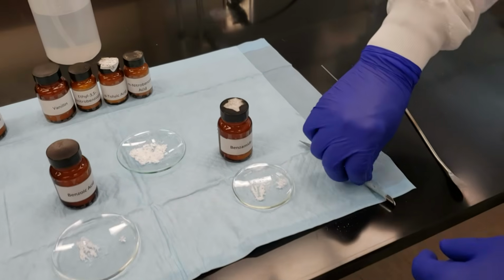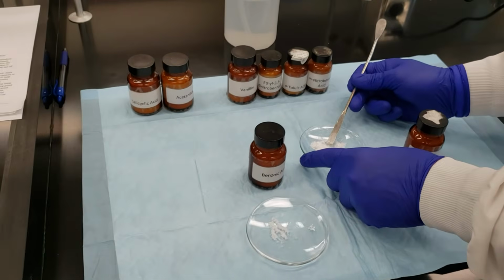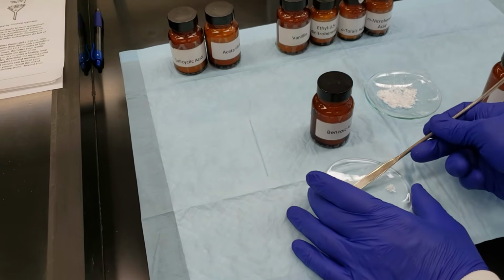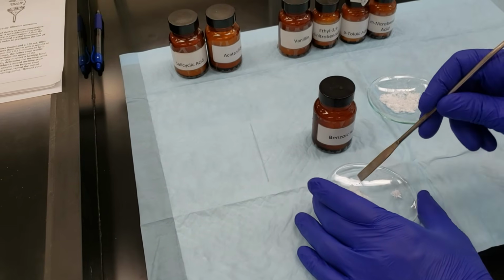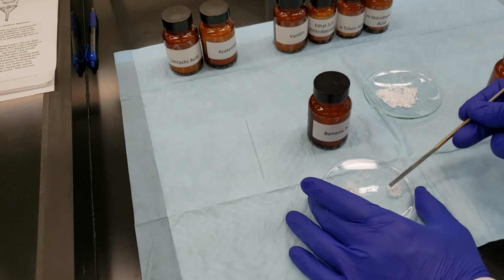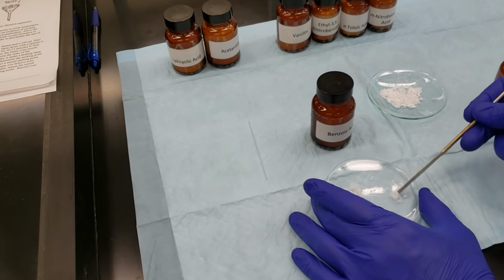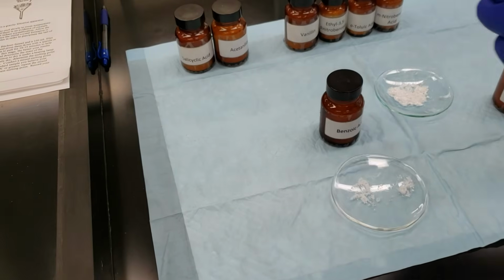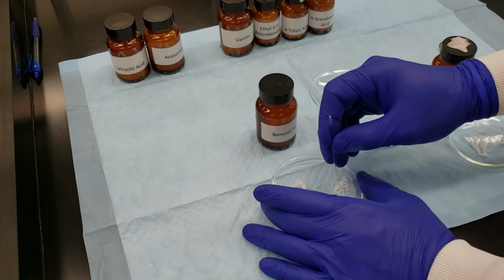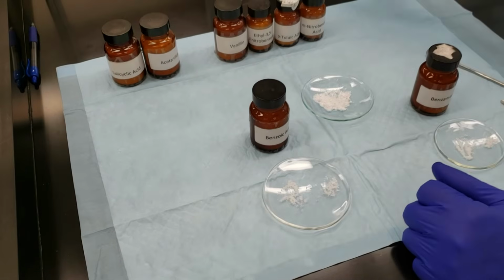Now I'm going to take, actually I'll take a fresh spatula. I don't want to mix these two. Then I'm going to do the same exact thing. Oh, I guess I already had a little bit right here. I'll do the same thing with my benzoic acid. I'll just bring it over from the side here. Mix these two together. Take another capillary, and go ahead and load that.